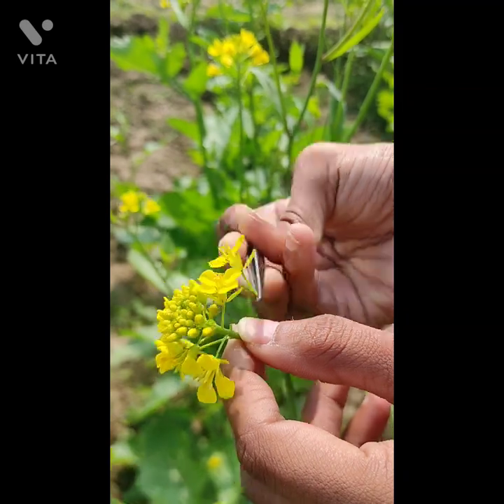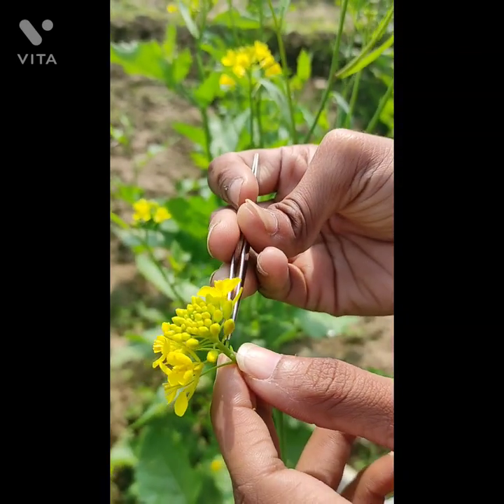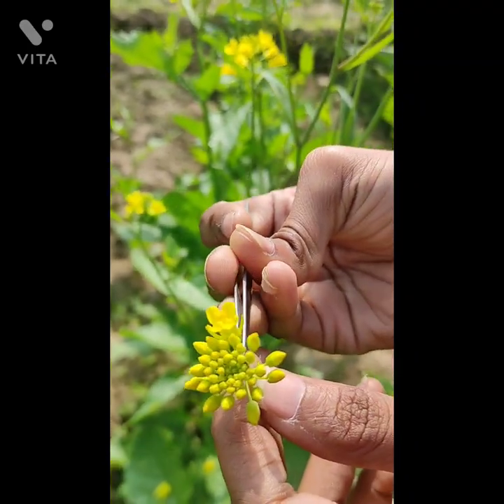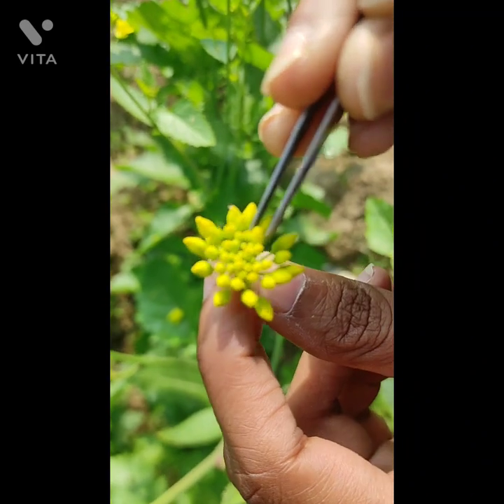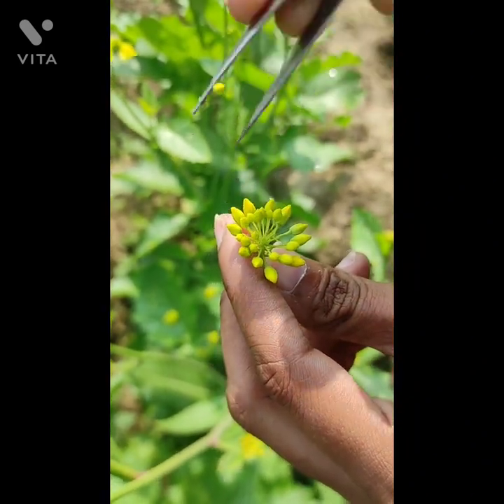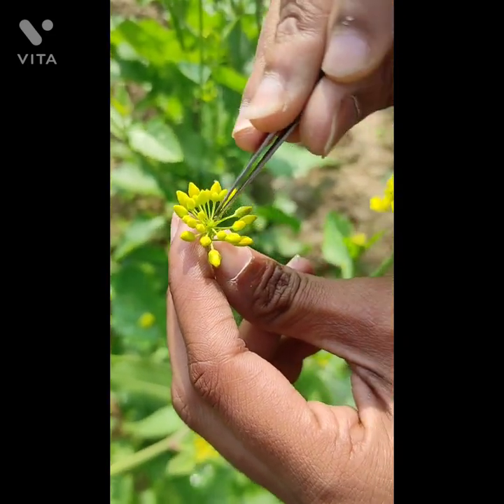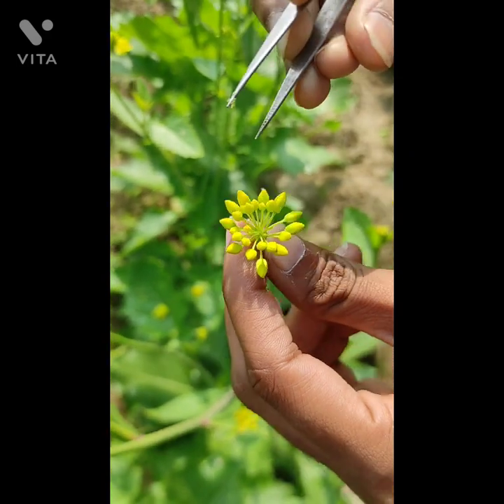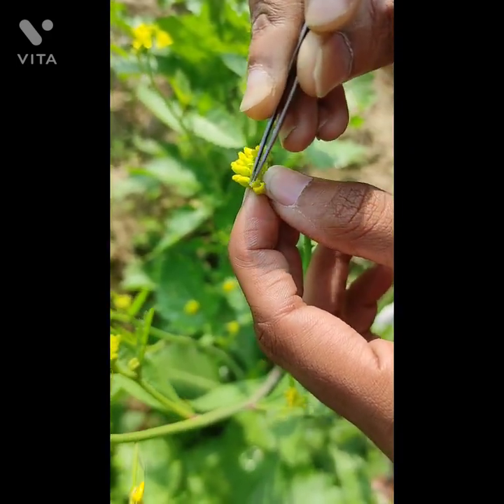Usually emasculation has to be done in the morning or evening hours before the anthers dehisce. Remove the immature buds and select 8 to 10 mature buds which are about to open on the next day. Hold the buds between the thumb, index finger, and the middle finger, and slightly pierce the buds with the pointed forceps.